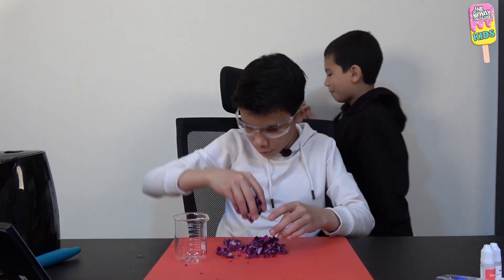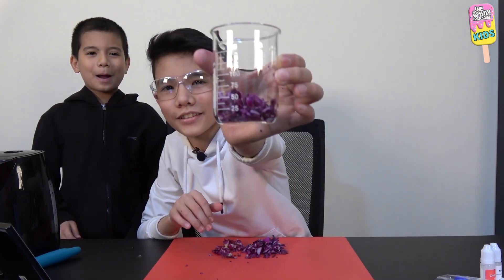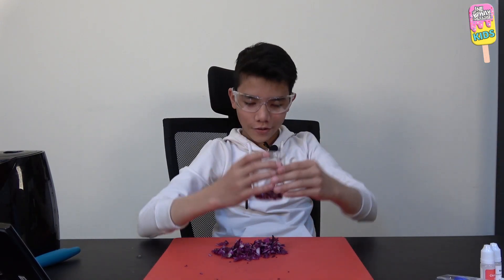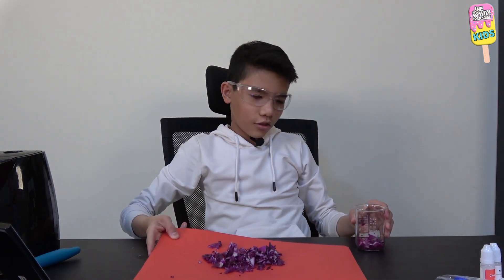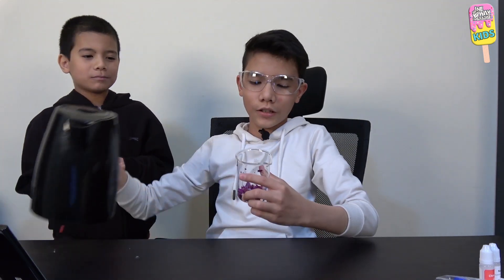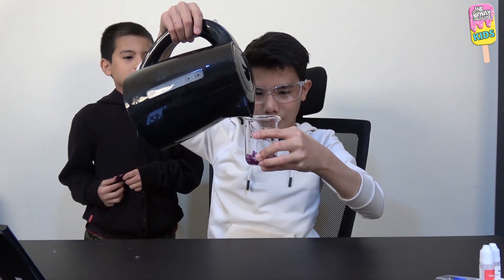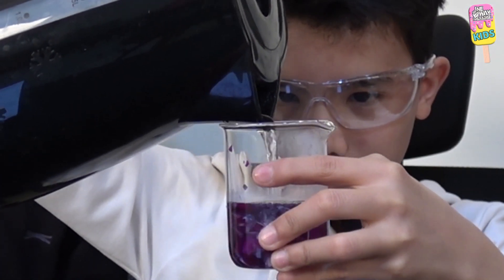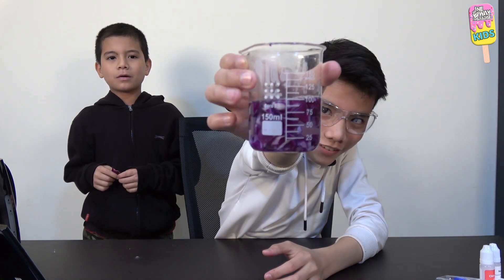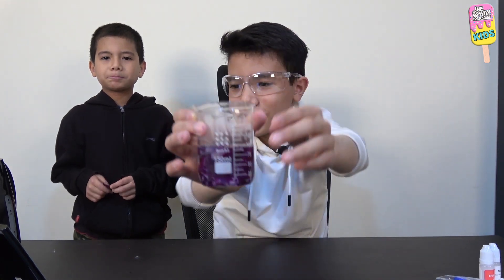Okay, I think I've done enough cutting. I'll now put the cabbage aside, get our glass beaker, and fill it up to 25 milliliters. Okay, it's reaching 50 — I think it's 25 now. The rest of this red cabbage won't go to waste. Next step is to add boiling hot water up to the 100 milliliter mark. It's pretty hot. For five minutes I will constantly stir this together.